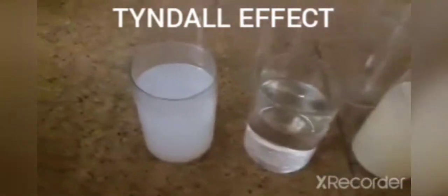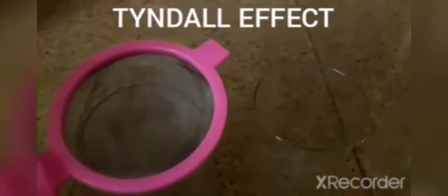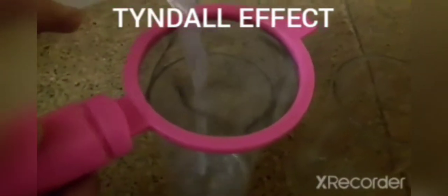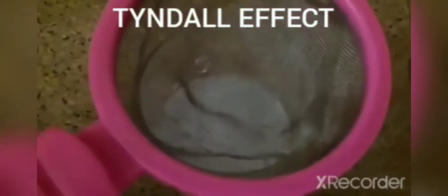So we'll check it. First we'll go with the colloidal solution. And we can see there is no residue left because the colloidal solution has its particle size between 1 nanometer to 1000 nanometers, so that is pretty small.